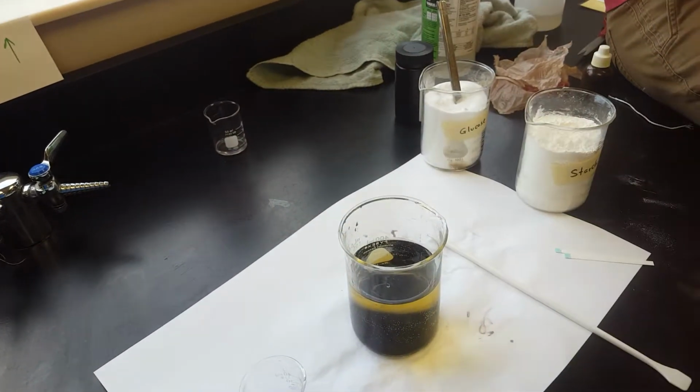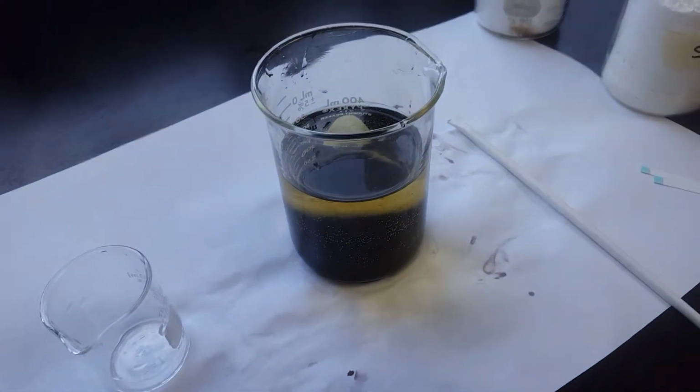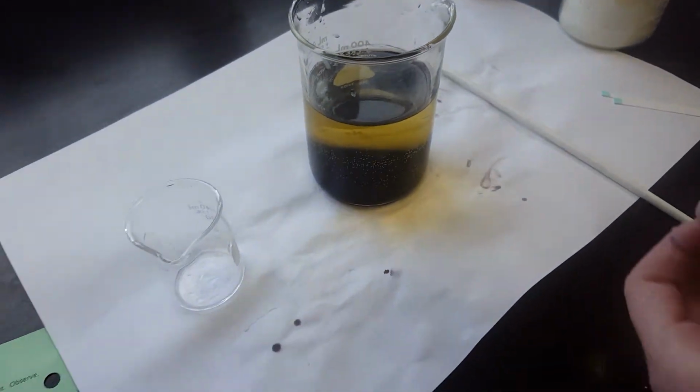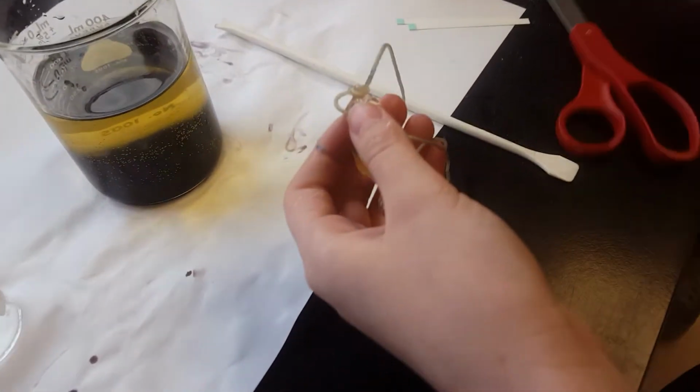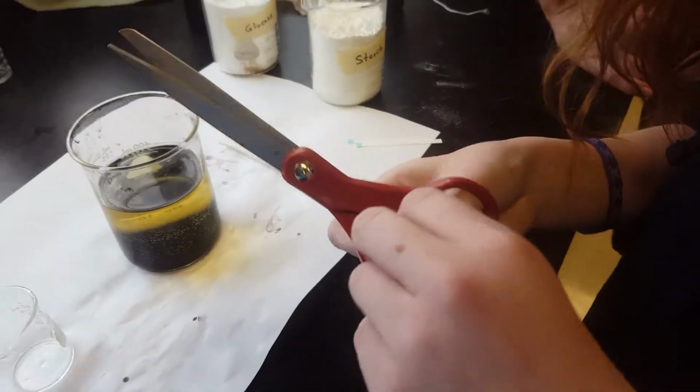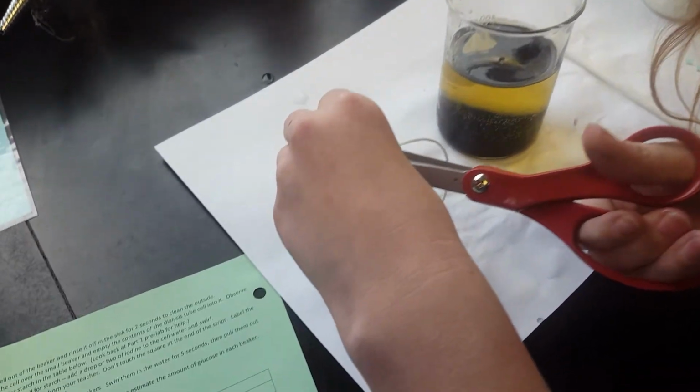So student assistant number 2, that'll work, that's fine. Just rinse it off for about a second or 2. Perfect, and then bring it back to the lab setup. And now she's going to cut open the cell using a pair of scissors and dump the contents of the cell into the small beaker. Good enough so that you can see what is inside of the cell.